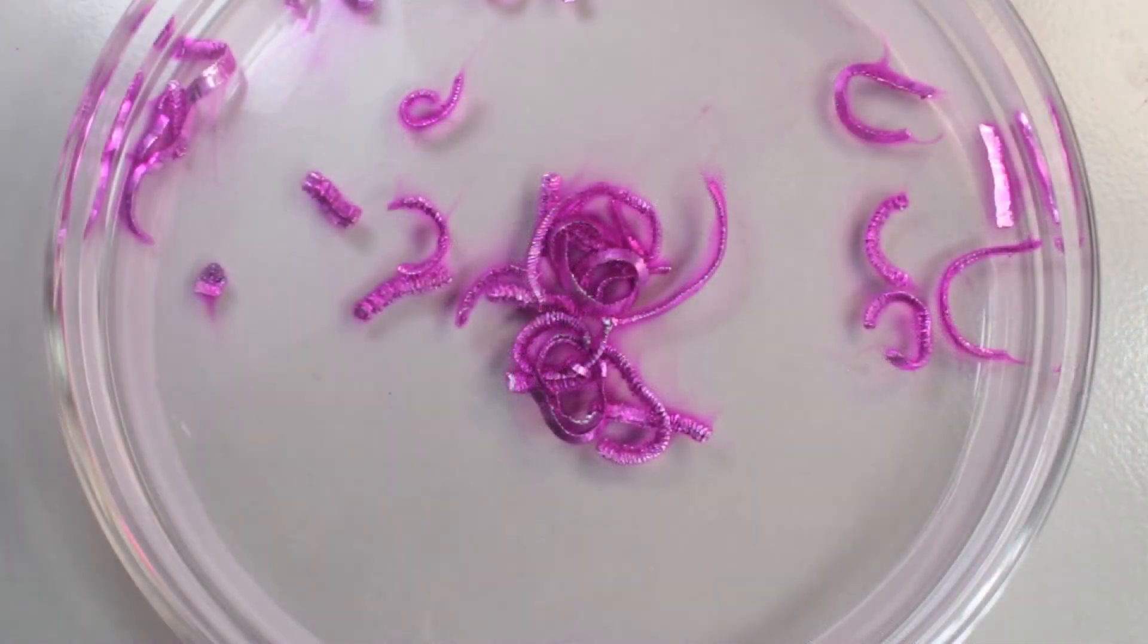If I take pieces of metal and just put them in distilled water with few drops of phenolphthalein, that's the picture I would see. Solution around the metal pieces turns alkaline as metal reacts with water.